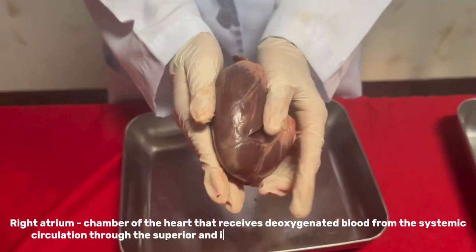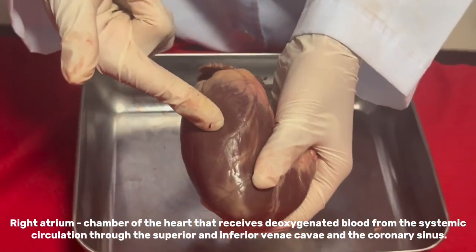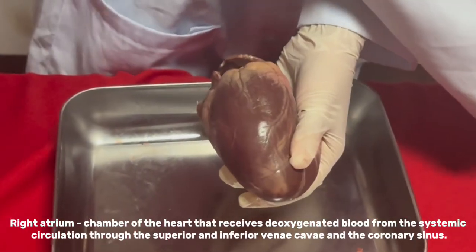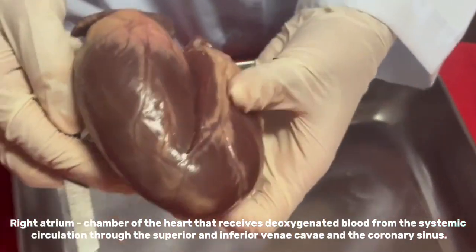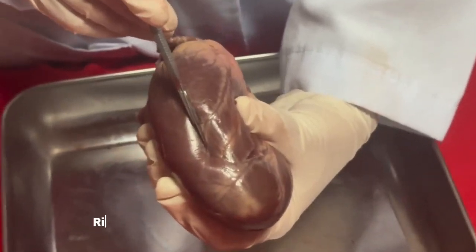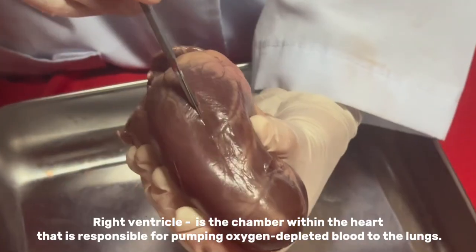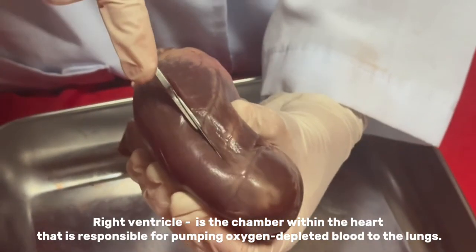The right atrium is the chamber of the heart that receives the deoxygenated blood from the systemic circulation through the superior and inferior vena cava and the coronary sinus. The right ventricle is the chamber within the heart that is responsible for pumping oxygen-depleted blood to the lungs.